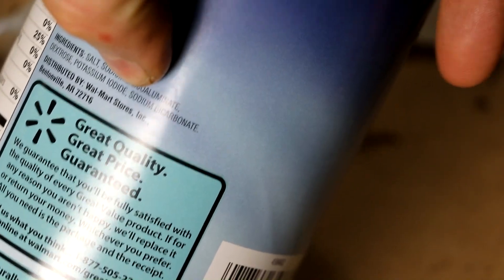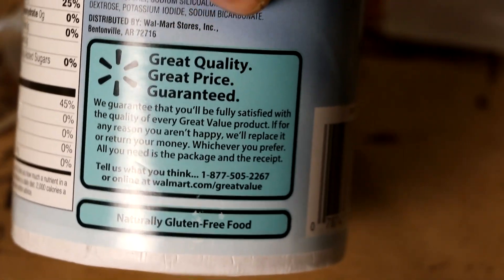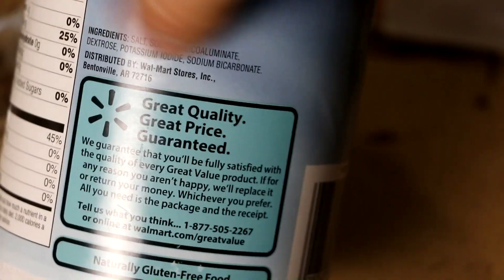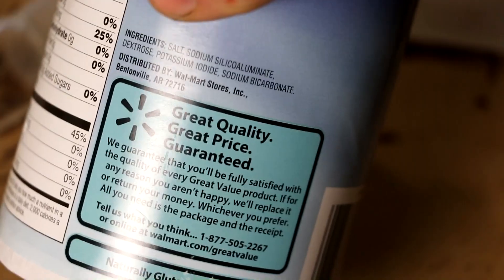And sodium bicarbonate. Alright, so sometimes they have sodium iodate in the salt for the iodine source. That would complicate things, I could still do it.